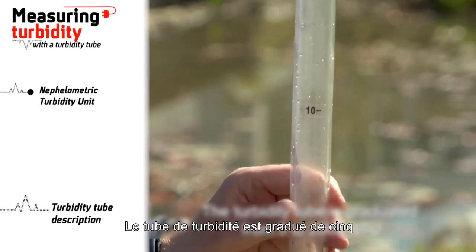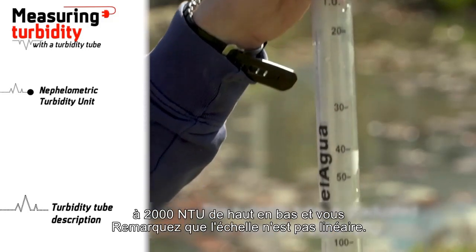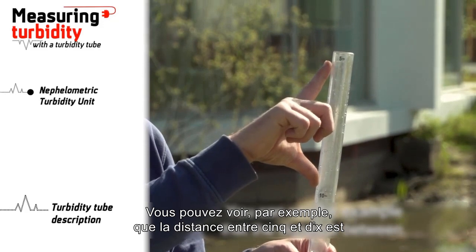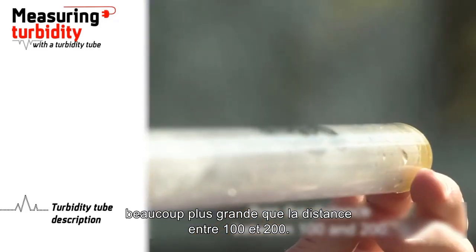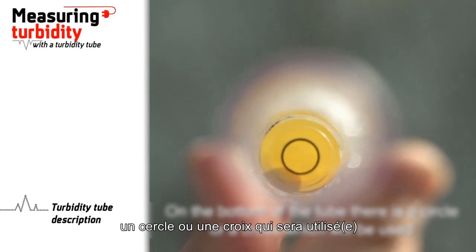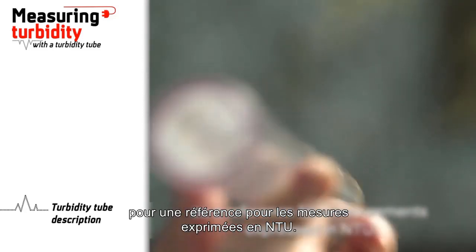The turbidity tube is graduated from 5 to 2000 NTU from top to bottom, and you notice that the scale is not linear. You can see, for example, that the distance between 5 and 10 is much greater than the distance between 100 and 200. On the bottom of the tube there is a circle or a cross, which will be used as a reference for measurements expressed in NTU.